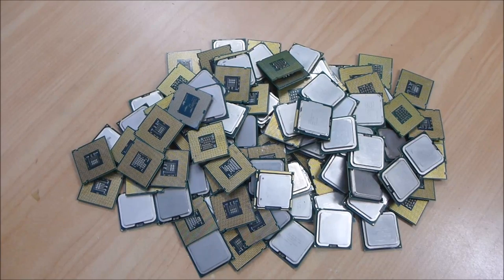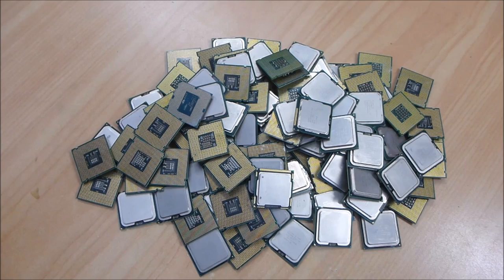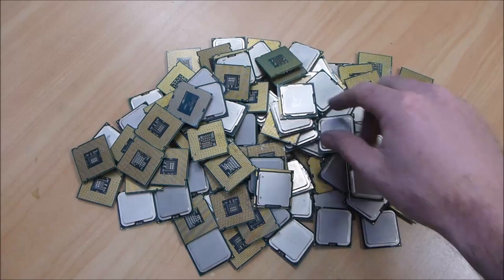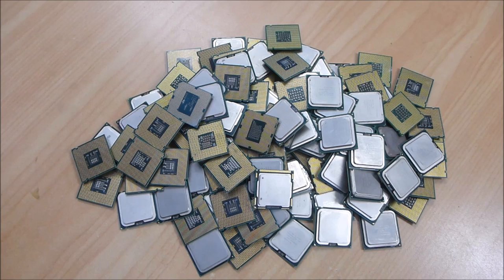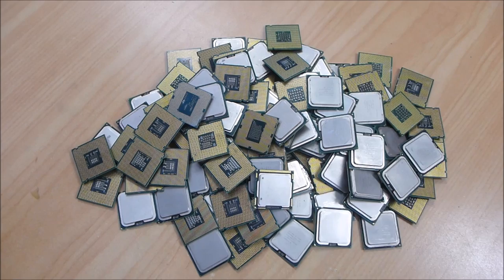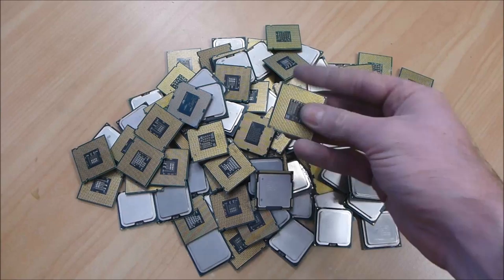In video number four of the hard gold versus ENIG series, I found that the gold coating on the bottom of the pinless processors appeared to be hard gold and not ENIG as I first suspected. In this video, we're going to process a whole bunch of these and try to get some idea of the gold value of the bottom plating of each pinless Pentium 4 or Celeron CPU.